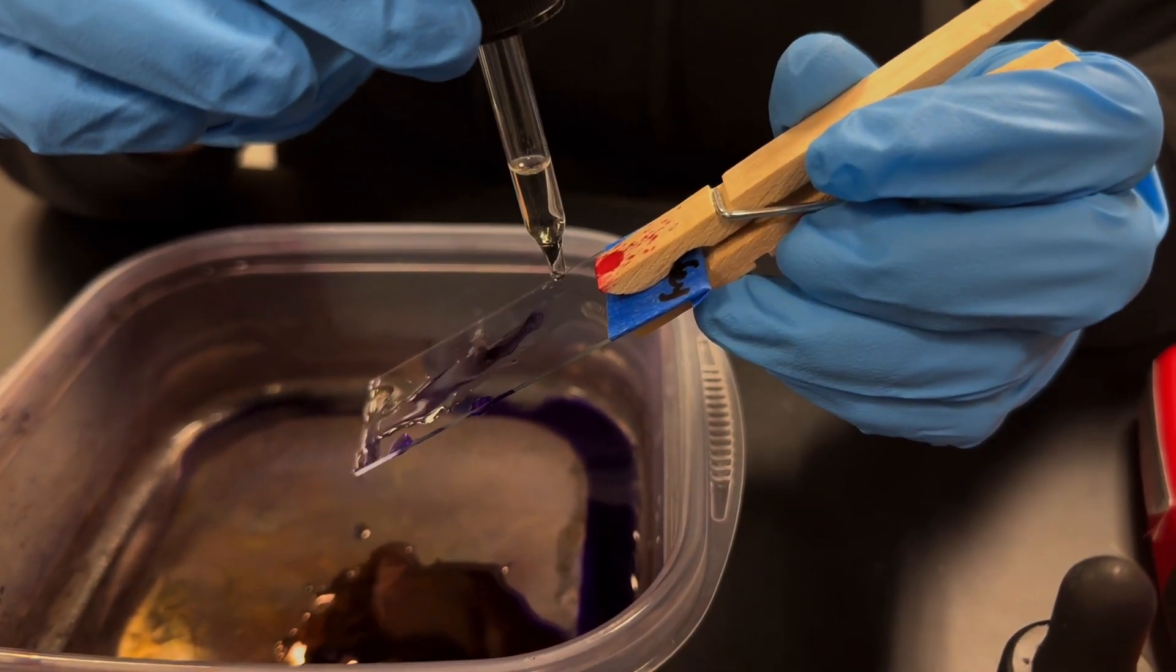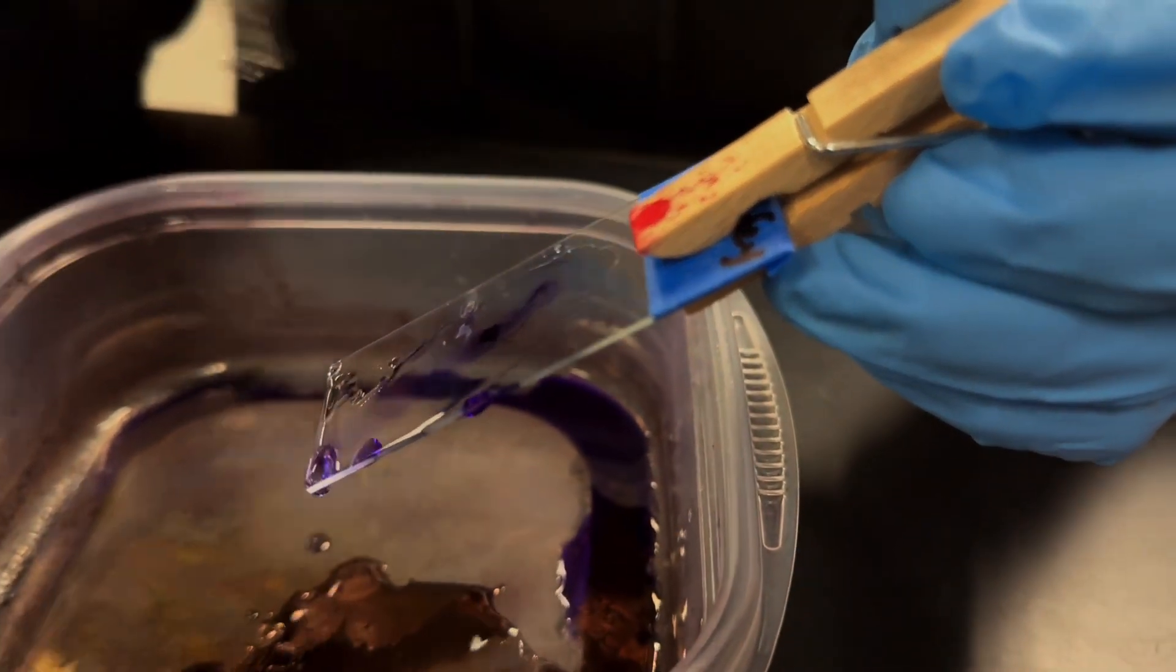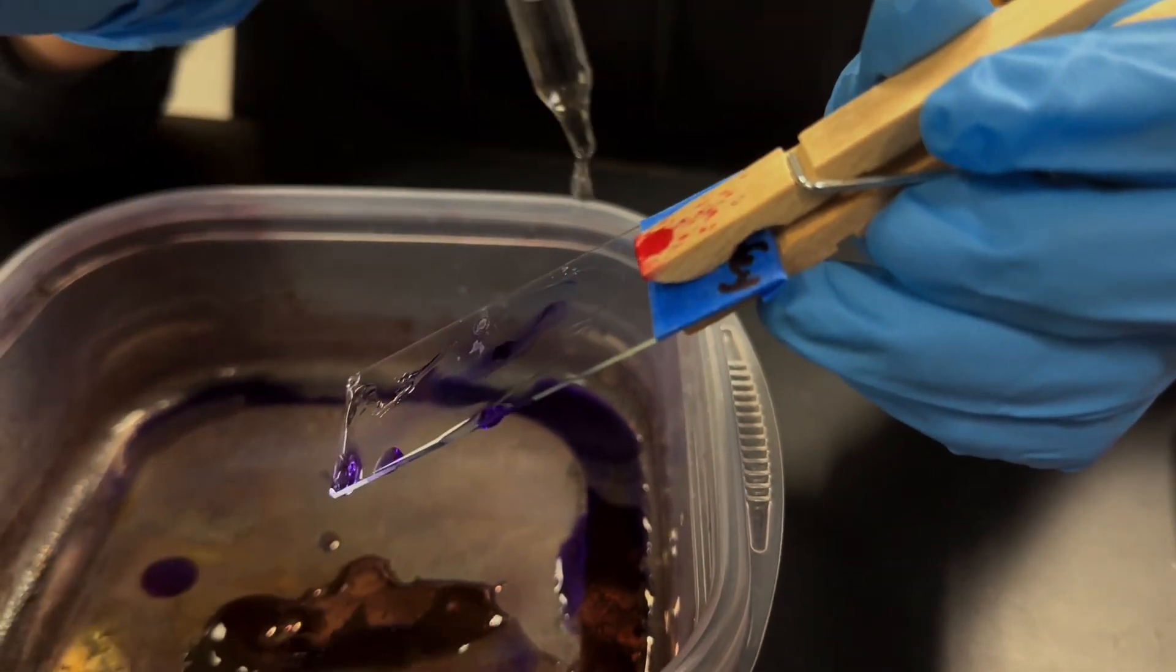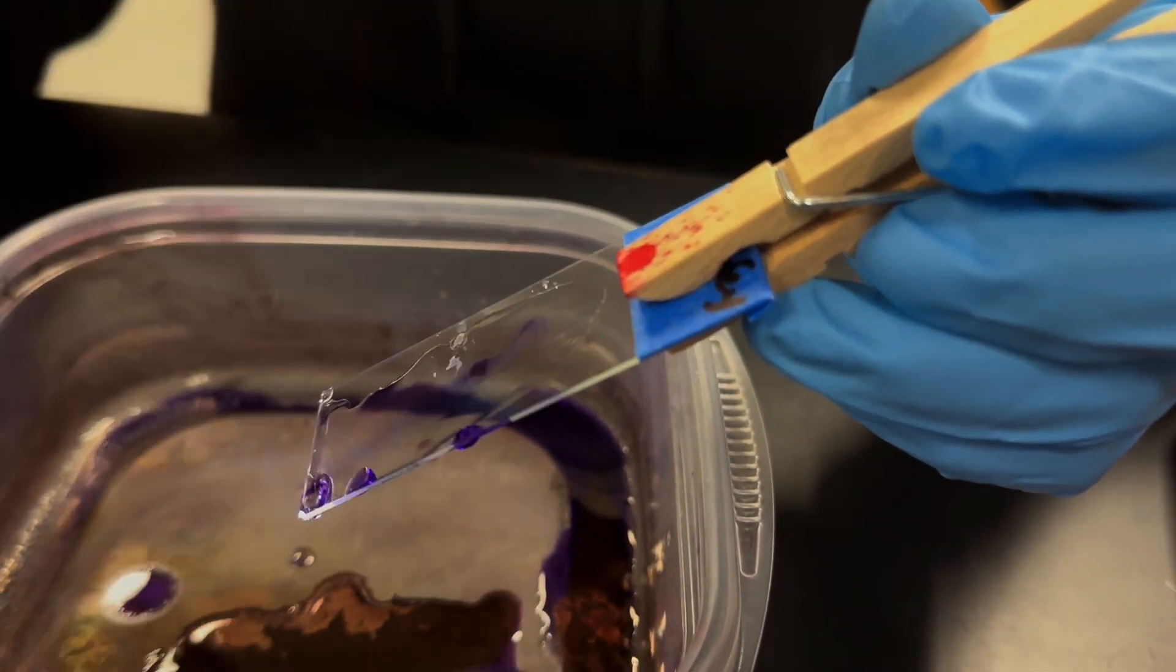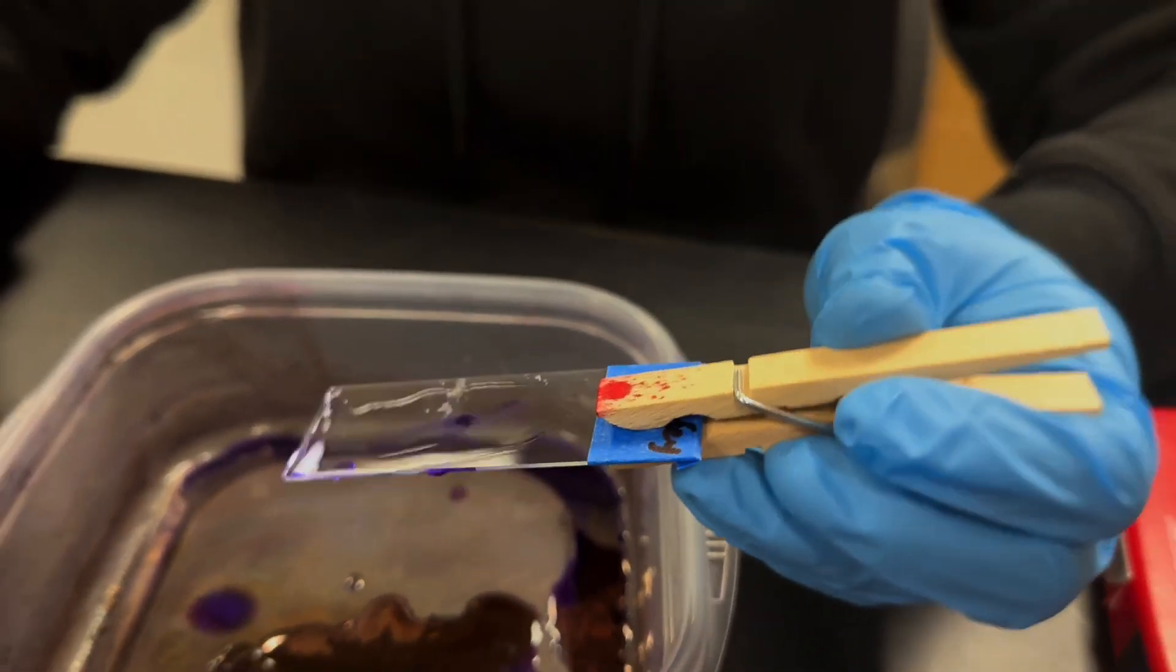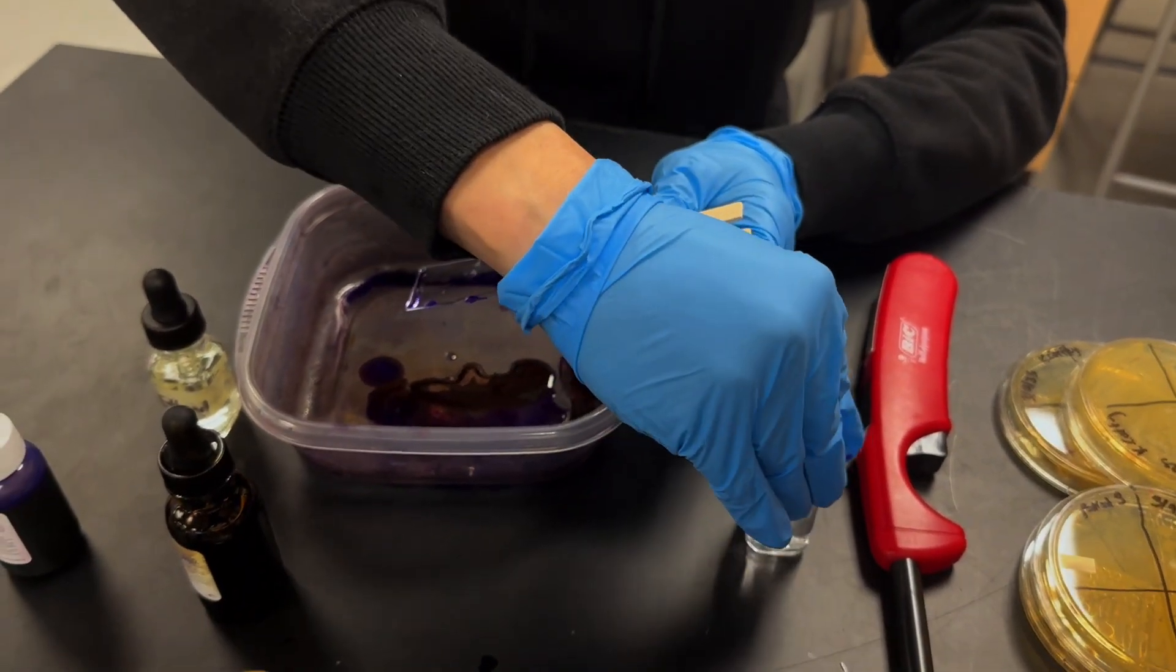You can see the colors coming out of my sample. I'm going to keep going. I need a little bit more and I don't see any more color leaving. So I think we're good on that step. And then we're going to rinse with water just like we did before.